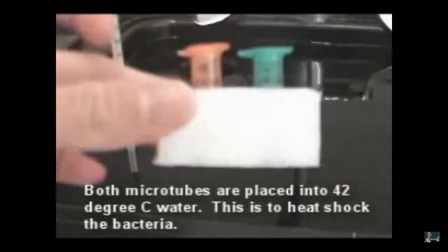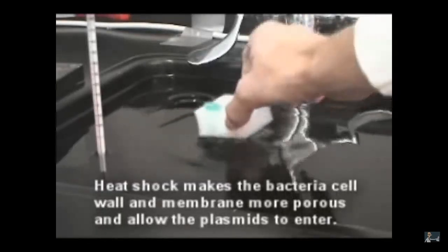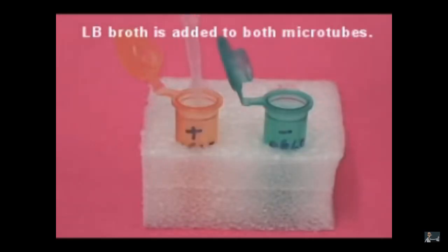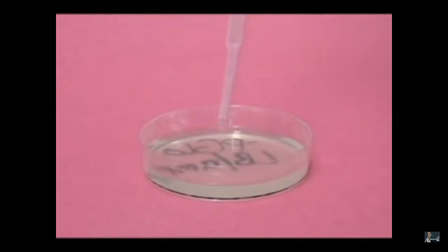And then they chill it and then heat shock it at 42 degrees for 50 seconds. And then they'll cool it. Add some nutrient broth and let the tube sit for 10 minutes. Remember, while the tubes are sitting for 10 minutes with nutrients, they're transcribing and translating the plasmid, especially the beta-lactamase gene. So when we spread the bacteria on the surface of the agar plates with ampicillin, the E. coli will survive.